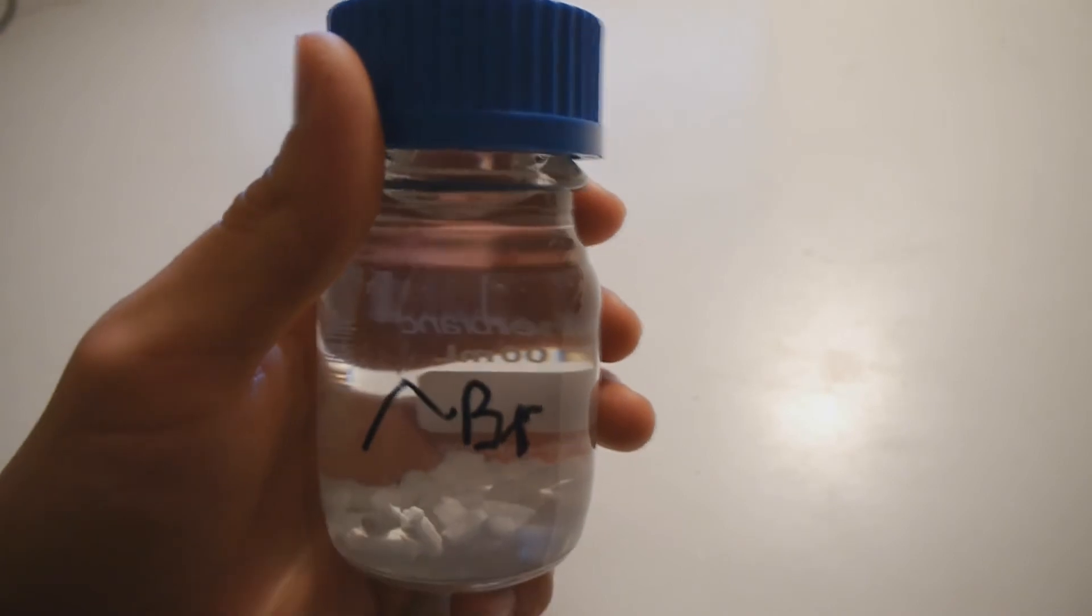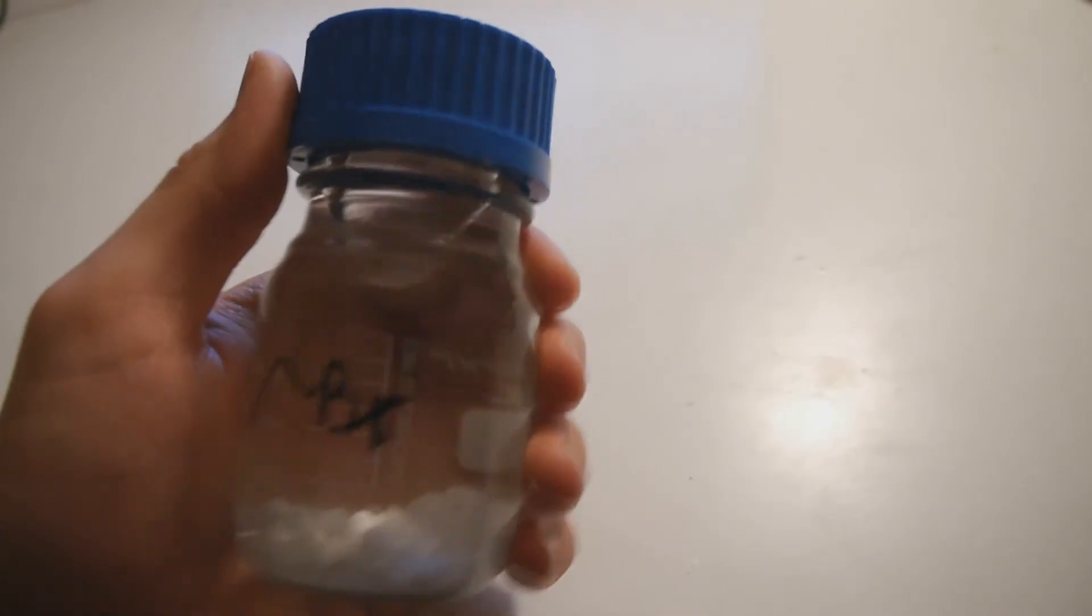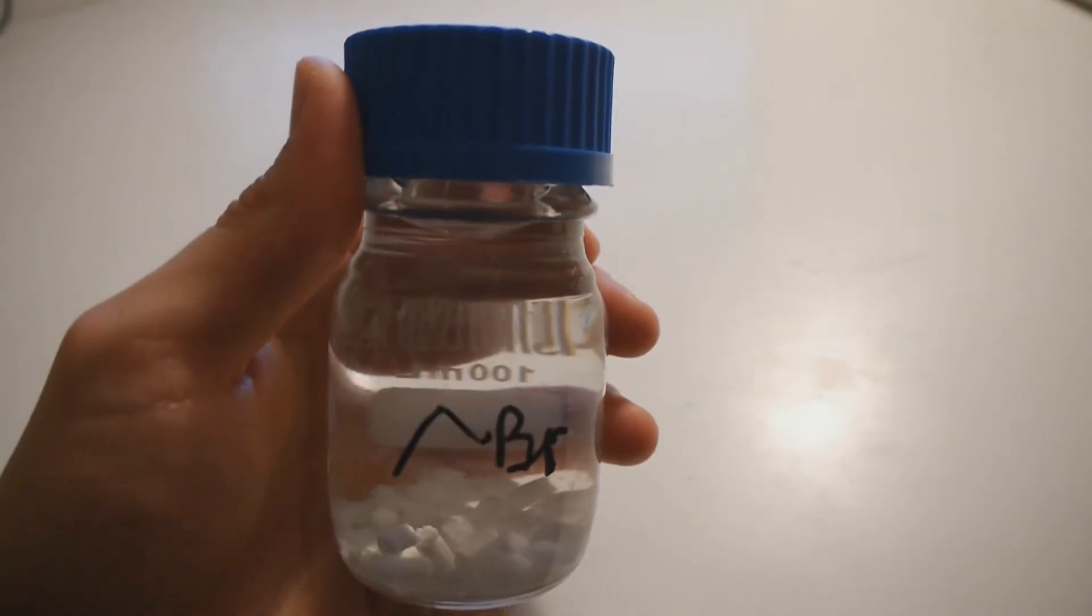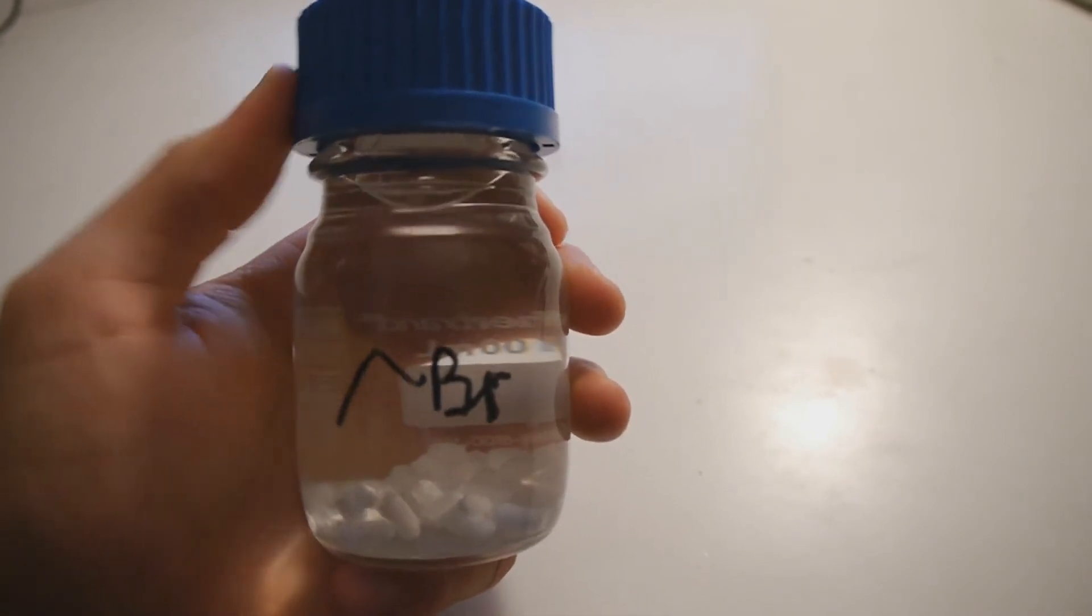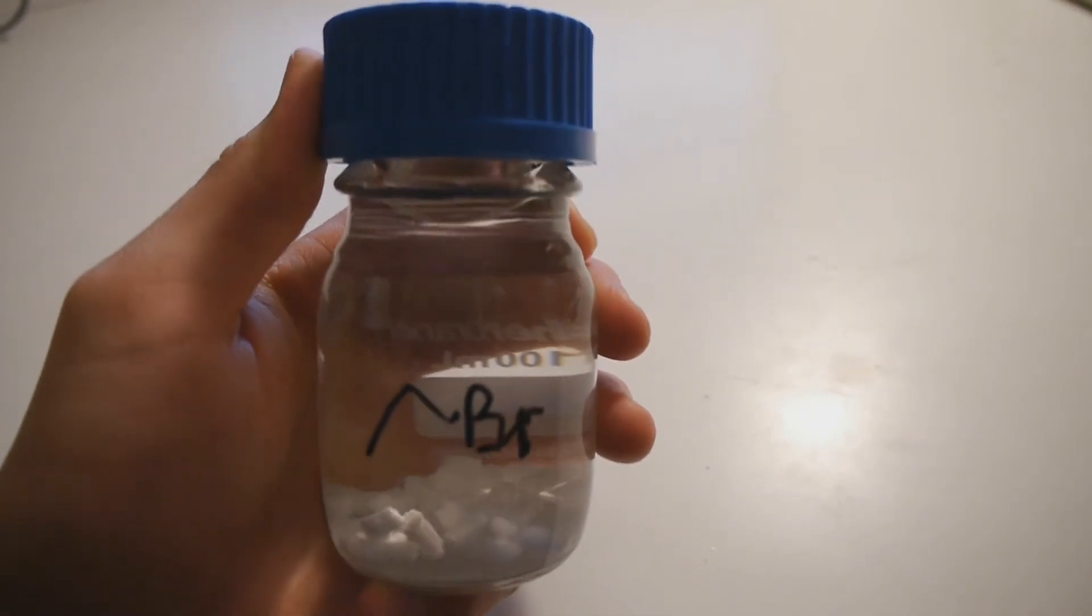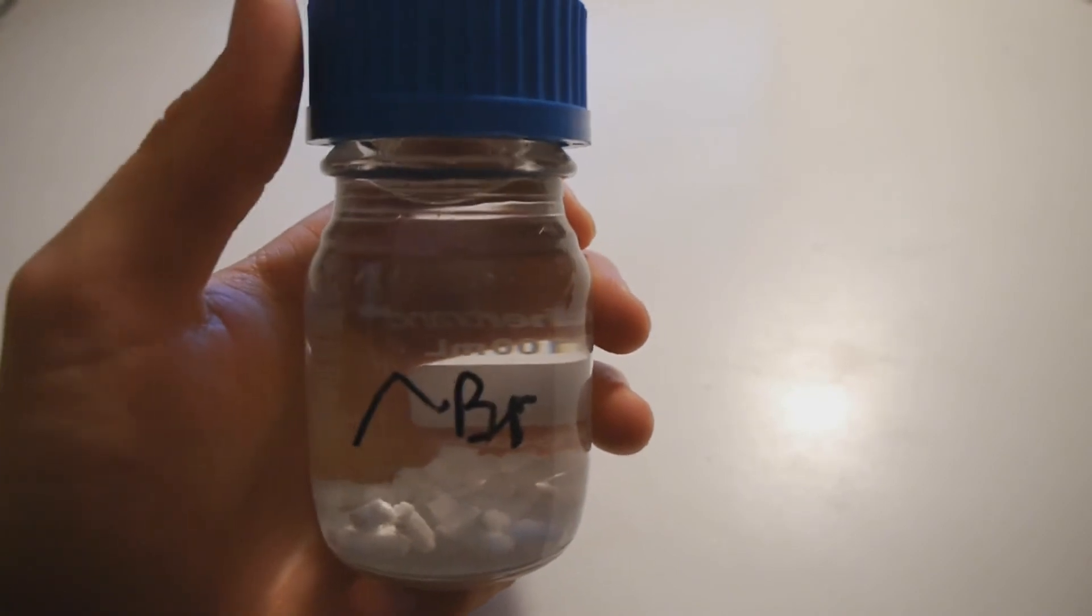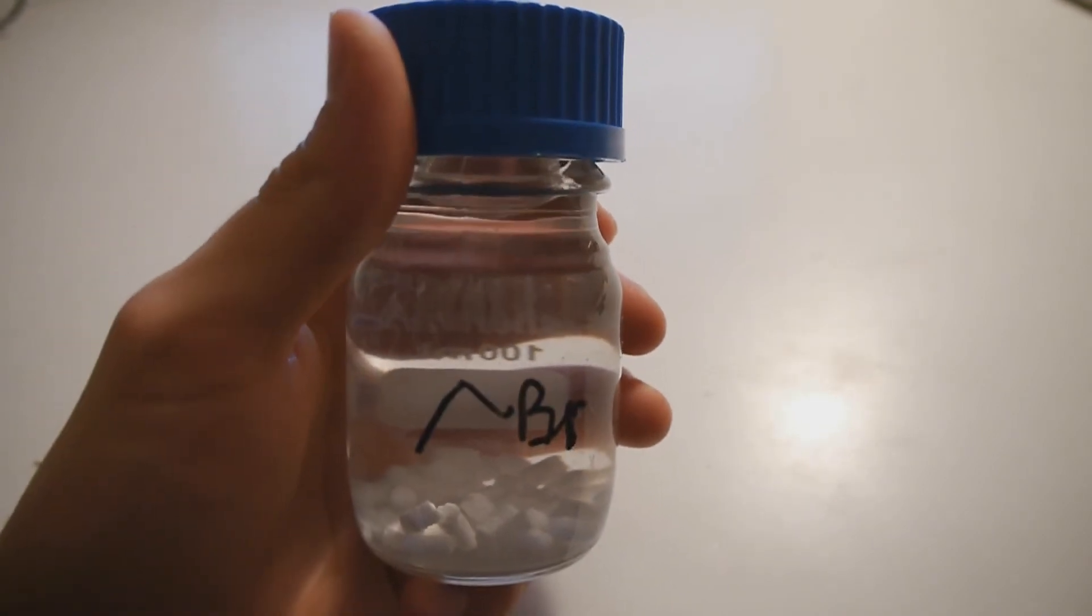I might do the synthesis again but on a larger scale. But for now I think I have enough product to work with. We'll see. If I need more, I'll do it again on the biggest scale, and then it will probably work a lot better now that I have some experience.